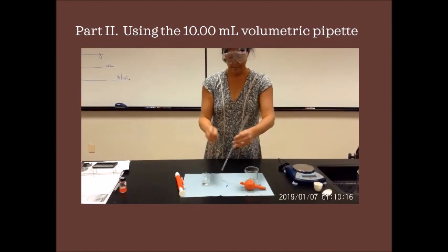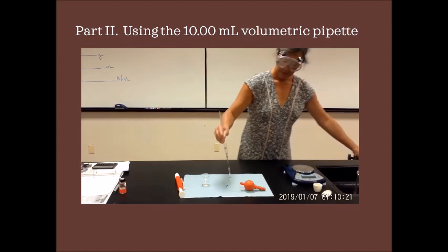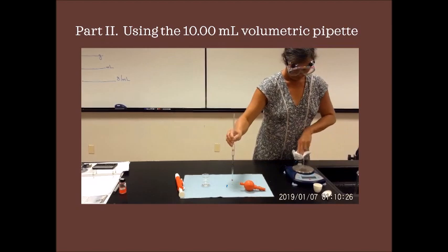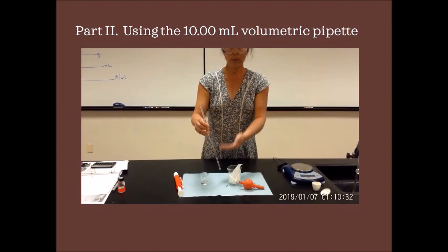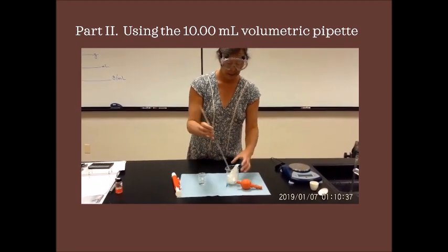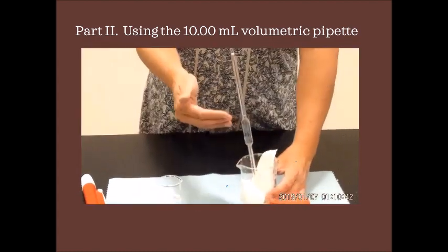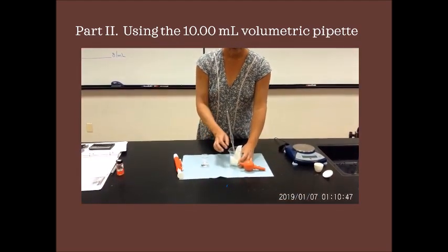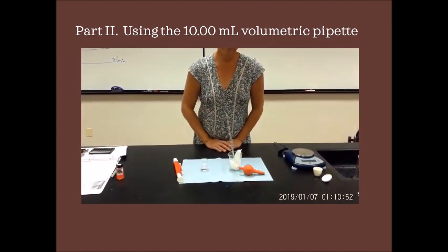When you are done, the way you store it, you'll find that we often have an empty large beaker with a paper towel at the bottom. When you rinse it out with DI water, deionized water, to make sure it's nice and clean, you store it upside down in the large beaker to let it air dry. This allows all the deionized water to rinse out your solution. Air dry, and you want to protect your tip because that's really important for the calibration of your glass pipette.